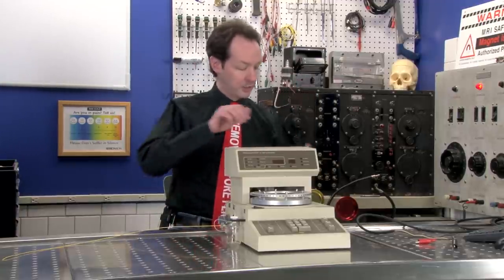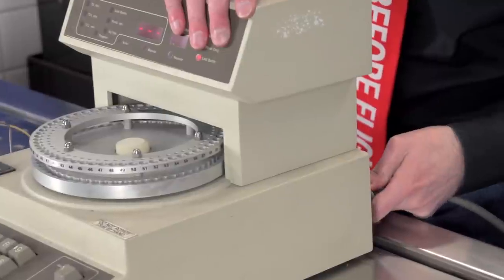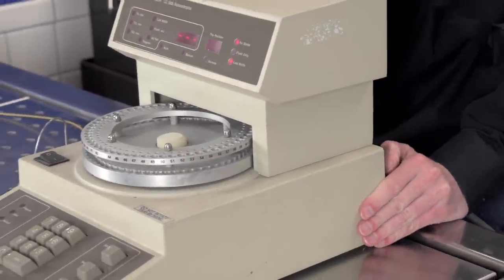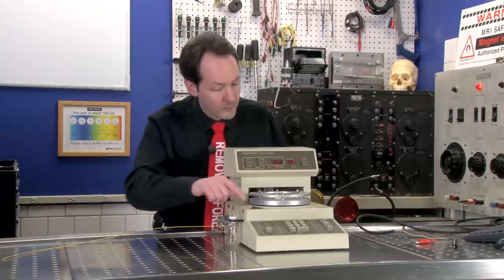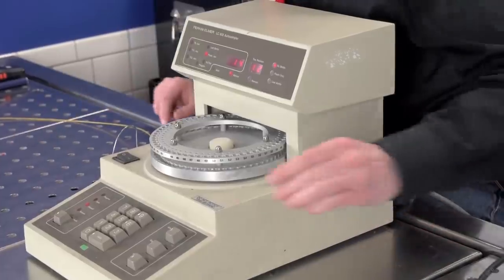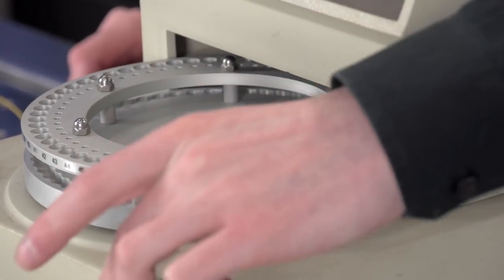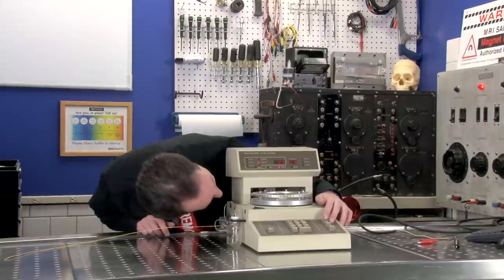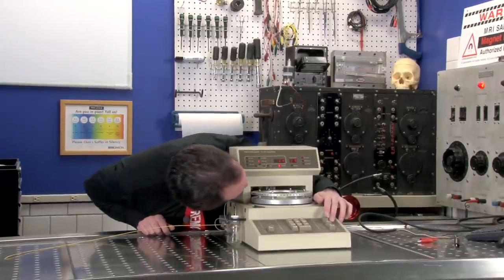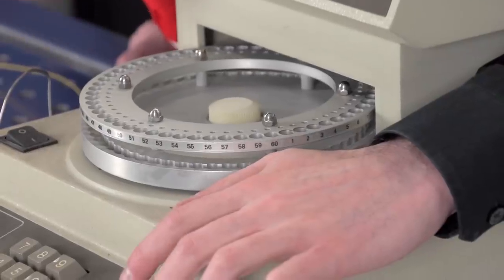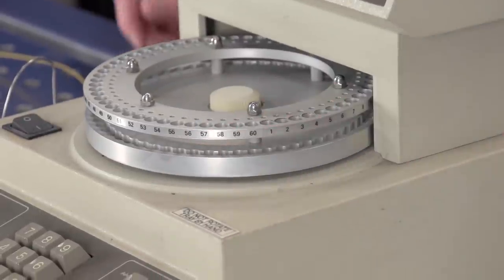I'm going to begin with the plug. Let's see what it does. Oh, it goes ting. Oh, you've got a machine that goes ting.